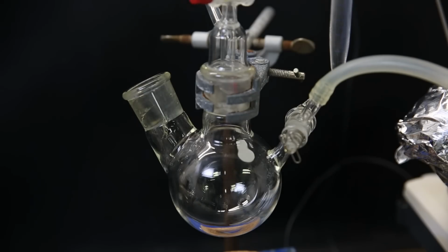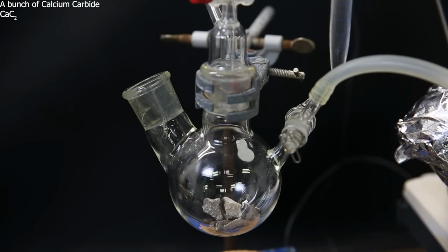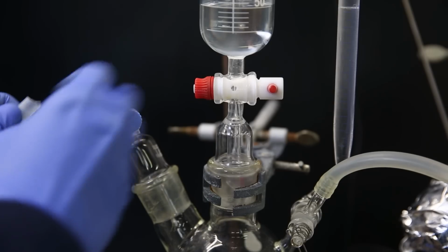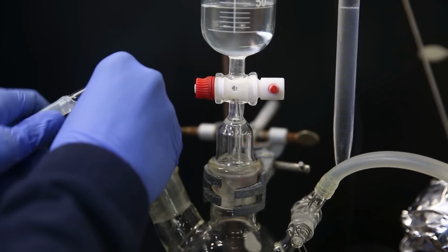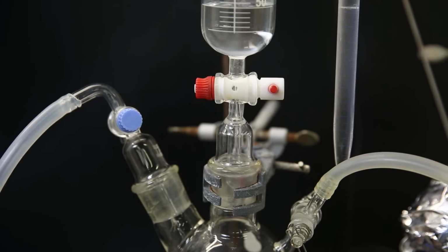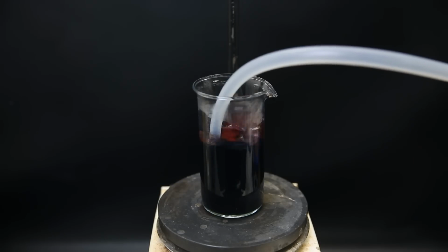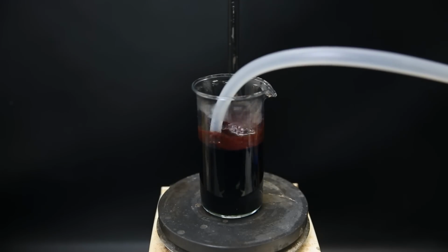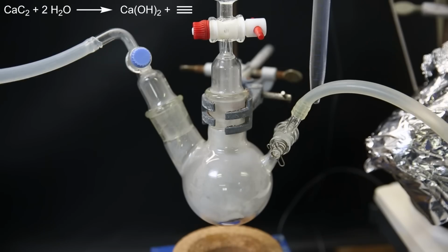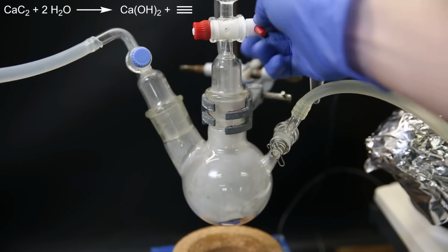I add some more ammonia to make sure it all reacts, and in the meantime I set up an acetylene generator. It is just a flask with a dropping funnel, and into that I add some calcium carbide pieces, which basically look exactly like rocks. I add some water to the dropping funnel, and then to the flask I connect the gas adapter with a hose. On the right side of the flask I have connected a nitrogen cylinder. I first purge the air out of the apparatus by blowing nitrogen through it, and then add some of the water to the calcium carbide, which generates acetylene. The acetylene immediately reacts with the copper 1 complex to produce brick red copper 1 acetylide. I continue generating acetylene by adding water to the calcium carbide, and wait until no more copper acetylide is produced.